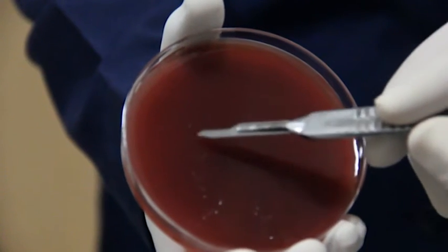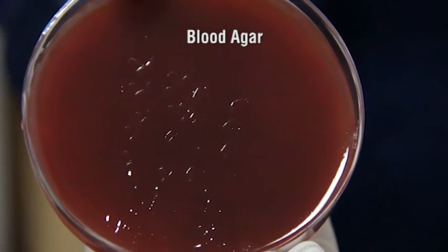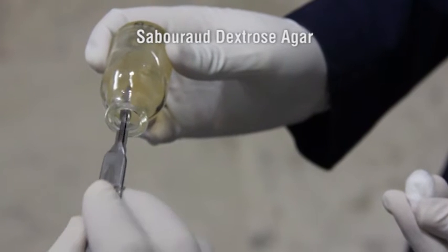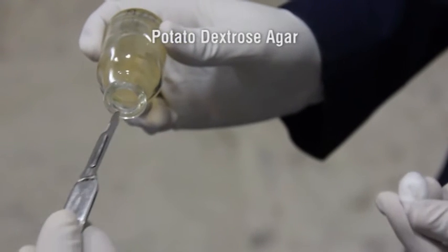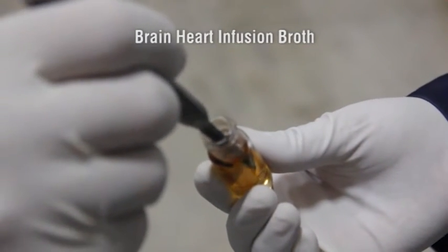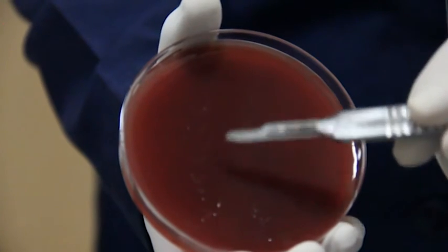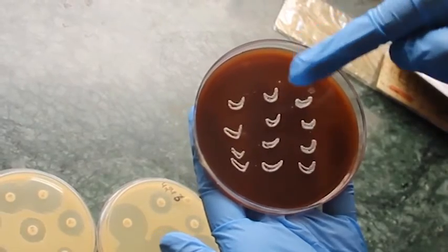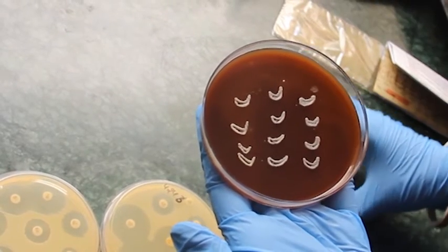The sample is carefully plated on agar plates. Blood agar, chocolate agar, Sabouraud dextrose agar, potato dextrose agar, and brain heart infusion broth are used. The scraped tissue should be placed as multiple C-shaped streaks on the culture plate so that growth on the C-shaped streak can be noted in a decreasing gradation.